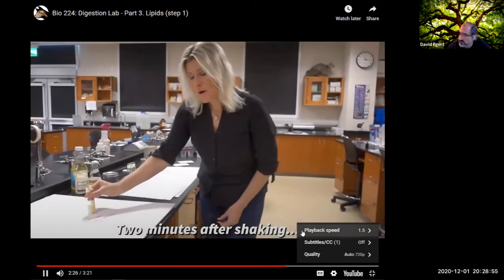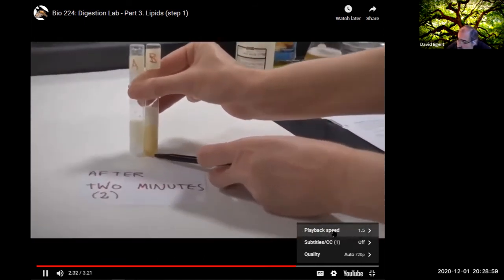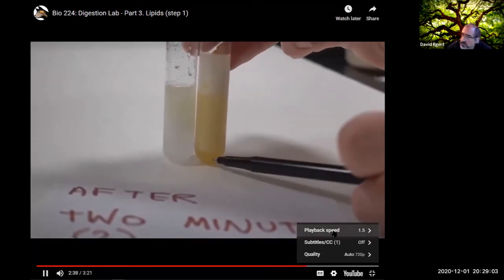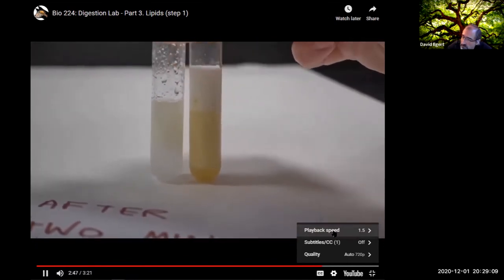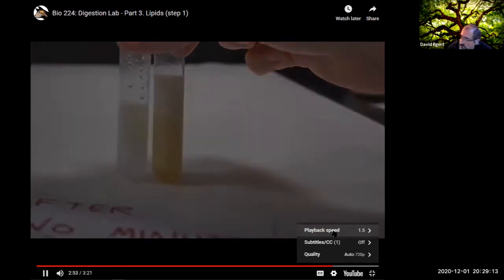All right, so we're going to take a look at our test tubes now after 2 minutes. You can see at the bottom of test tube B, we have a little water down here. It's colored a little brown, yellowish because there are bile salts also in this water. You can see that in test tube A, we have the water layer and the oil layer coming back. So we'll wait another minute and take a look at what happens.